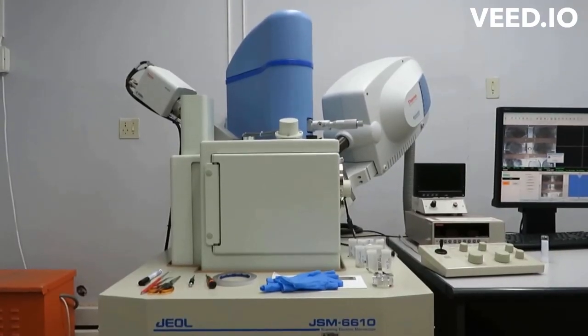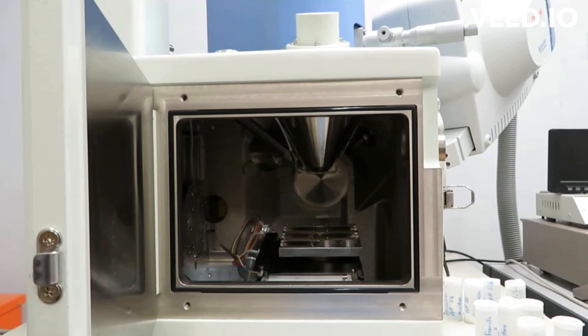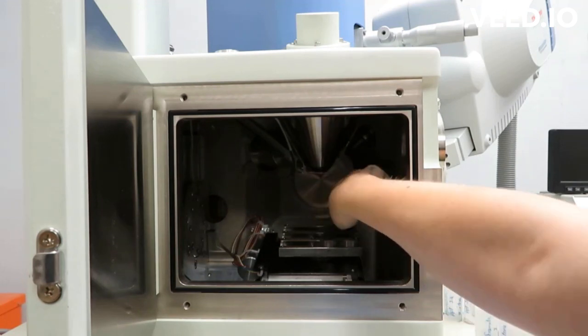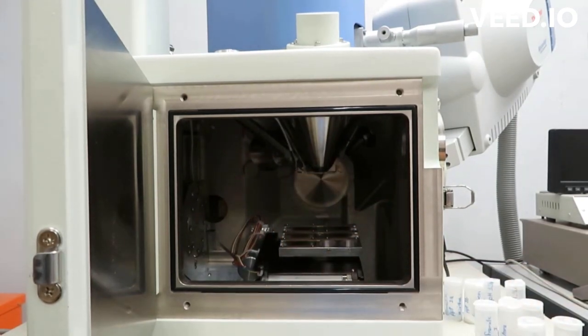Scanning electron microscopy or SEM. Scanning electron microscopy, or SEM analysis, is a powerful analytical technique to perform analysis on a wide range of materials at high magnifications, and to produce high-resolution images. This scanning electron microscopy is a test process that scans a sample with an electron beam to produce a magnified image for analysis. Electron microscopy is performed at high magnifications, generates high-resolution images, and precisely measures very small features in objects. Unlike optical microscopes, a scanning electron microscope uses electrons rather than light rays to generate images of the specimen being studied.